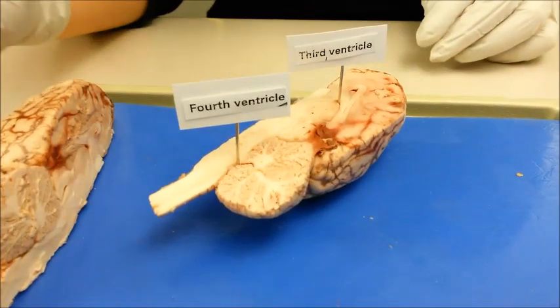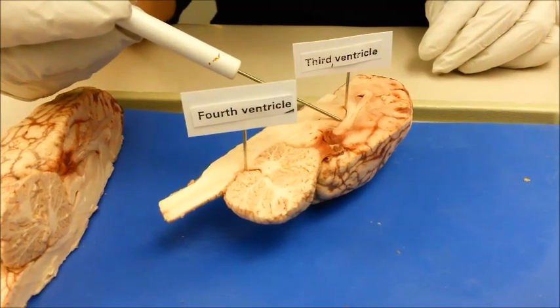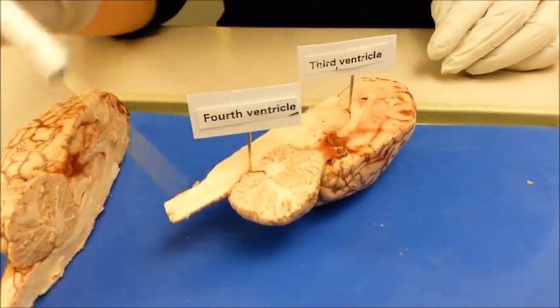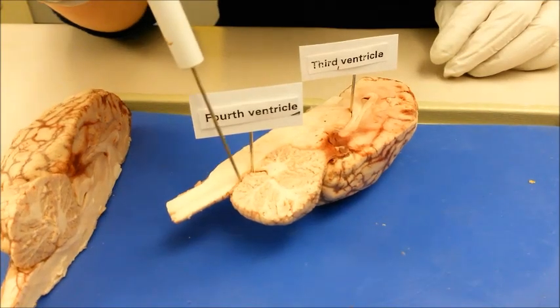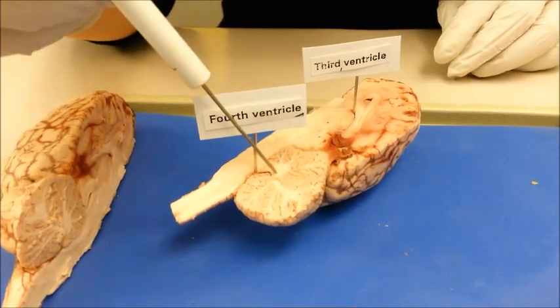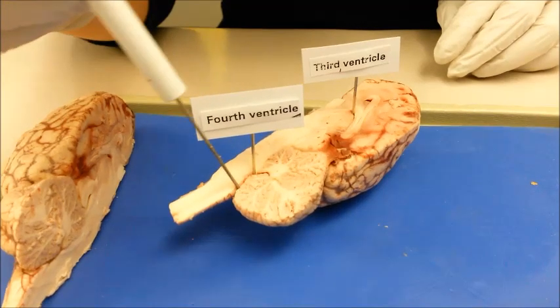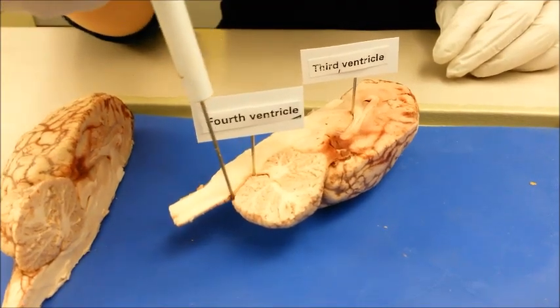The third ventricle creates cerebrospinal fluid, which helps to protect the brain from trauma and extends to create the central canal pathway of the spinal cord. The fourth ventricle holds the cerebrospinal fluid. Like the third ventricle, it protects the brain from injury and takes part in the creation of the central canal of the spinal cord.